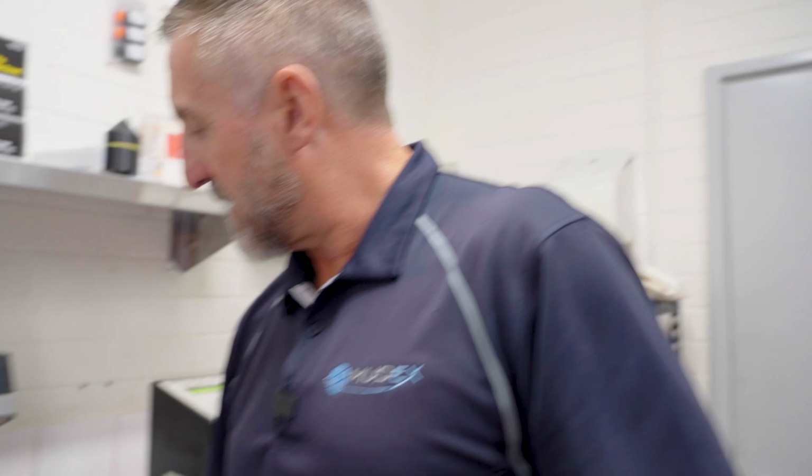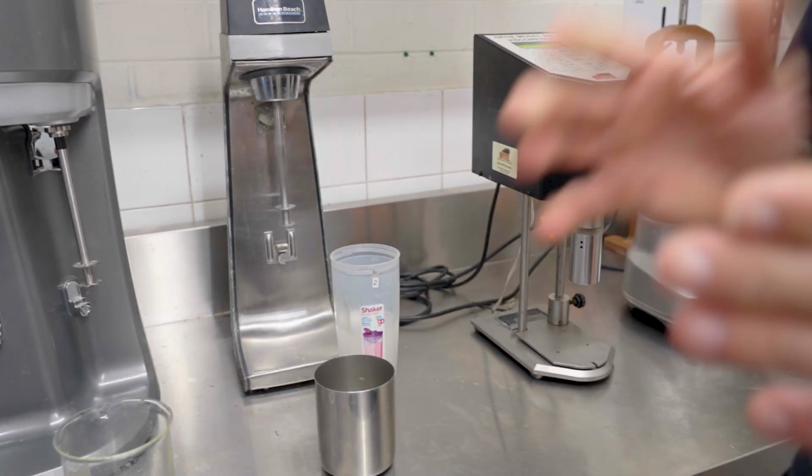We then compare that number to our original sample put straight into the Hamilton Beach. We can compare the two numbers and get a percentage of how dispersible that product is at, say, 30 seconds. This one we know is going to be pretty much at least 95% because we have very few lumps or anything caught in the screen.